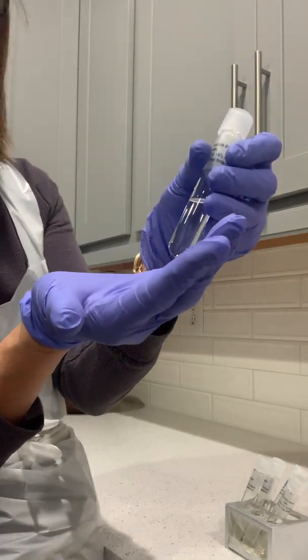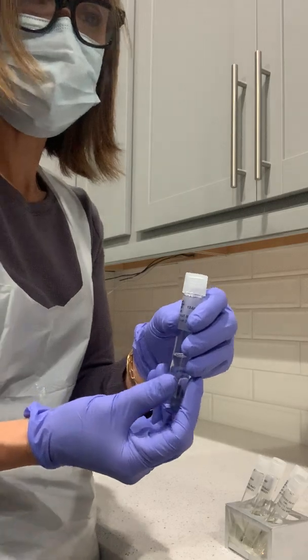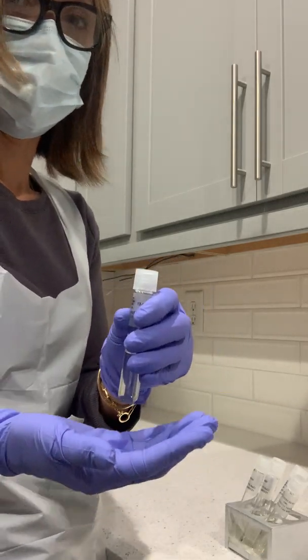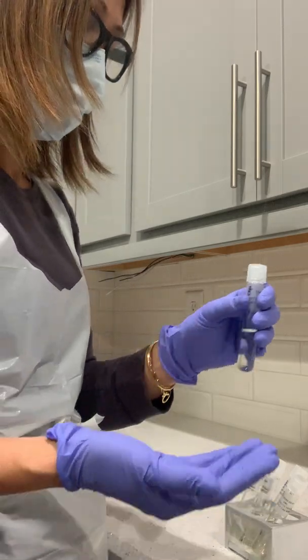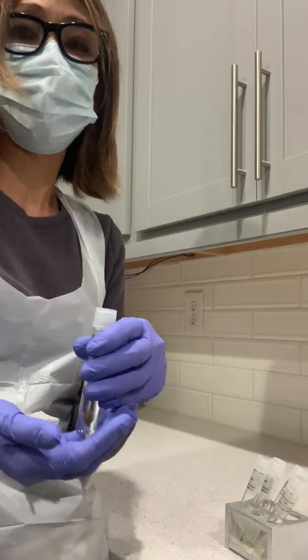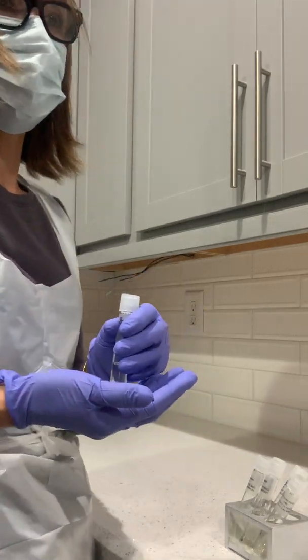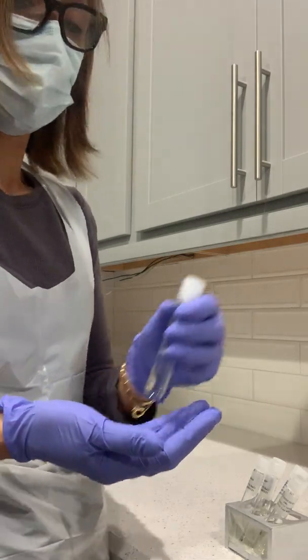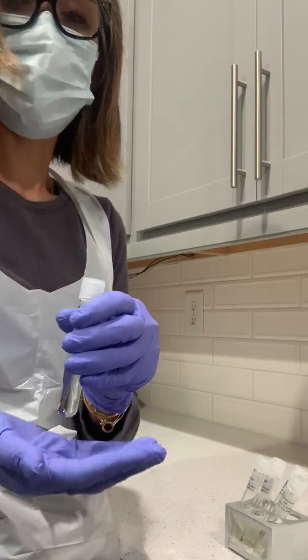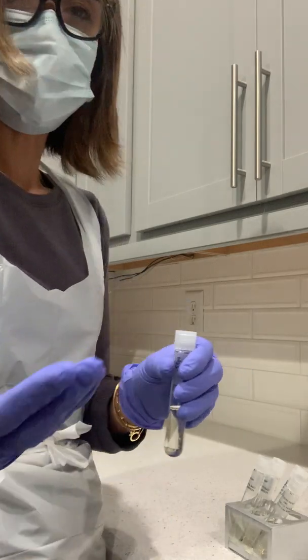When I did my research, it showed that it's a salt tolerant organism, but it should contain at least 25% sodium chloride, and our experiment only went up to 15% sodium chloride. However, I just want to let you know it does tolerate salt if it's 25% or more.